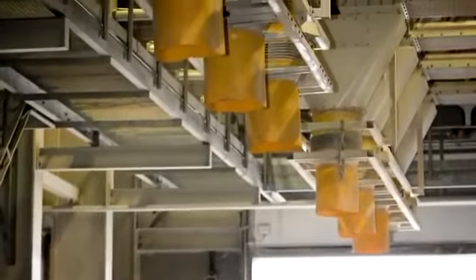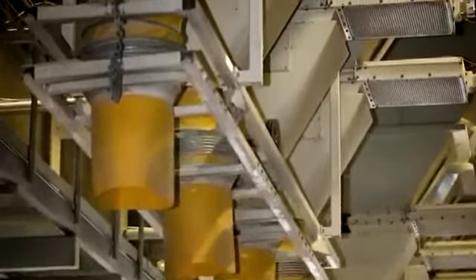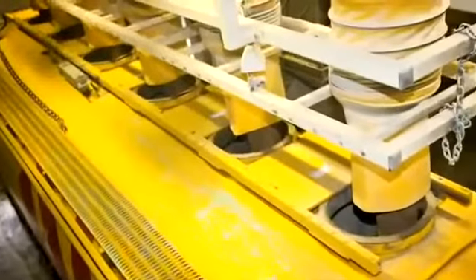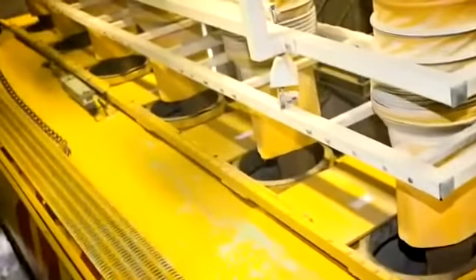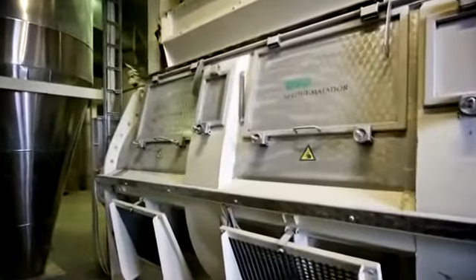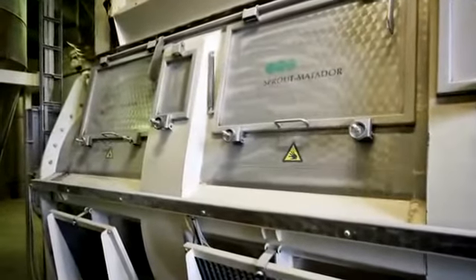When we are in process, we are sometimes in places where there's very high vibrations and temperature changes. There's a lot of things going on out there. And we want really to be independent. We want to go in the process where the real critical point is, and not 10 or 20 meters further down because the vibration is not as heavy down there. No, we need to be in the right place to be able to react and control our process as tight as possible.